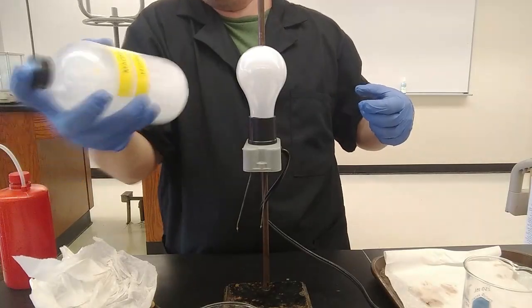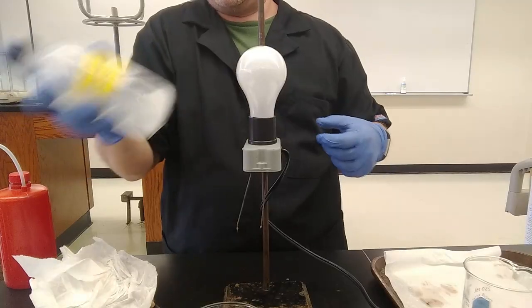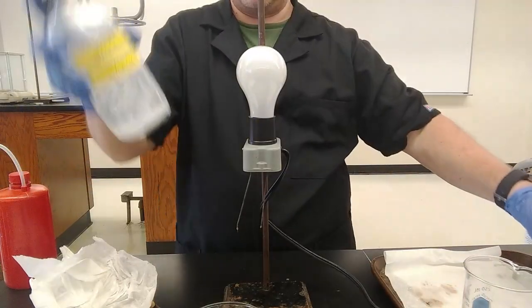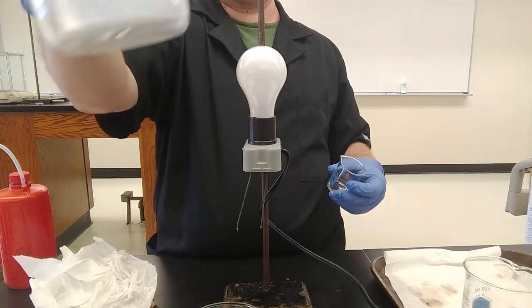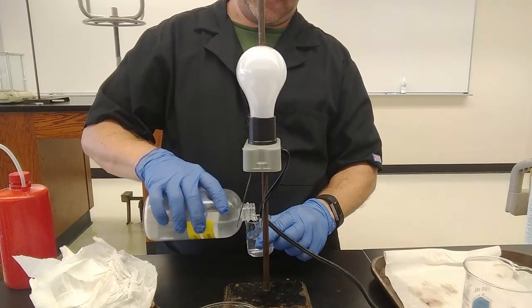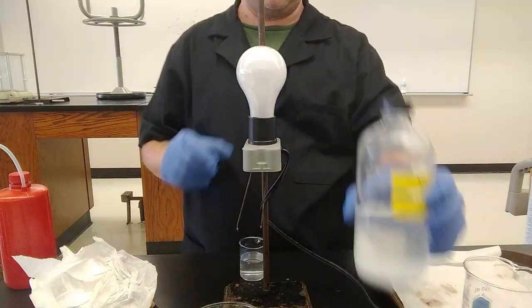If you ever take Mylanta for upset stomach, indigestion, then it says on the bottle to shake it. It's stuck to the bottom pretty good. But I think we got enough. All right, if any of it dissolved, it's definitely dissolved, and there's certainly a little bit swirling around in there. Let's see if this is ionic. Is it molecular? If it is ionic, did it dissolve in the water? Is it going to conduct?